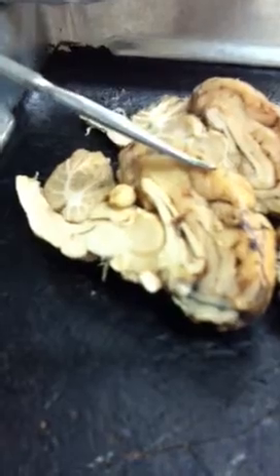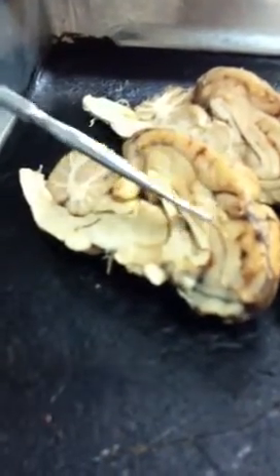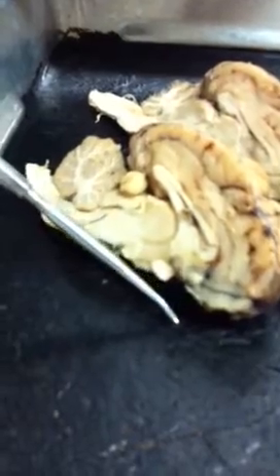The sheep brain cut longitudinally. It would be sagittal. Well, sagittal, down the longitudinal fissure. Okay. So then this is the midbrain, pons, and medulla.